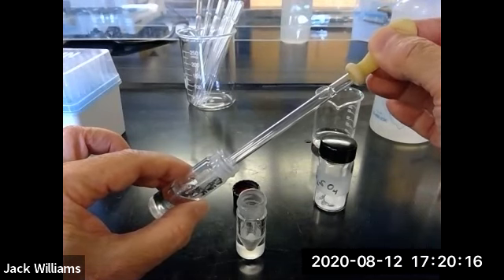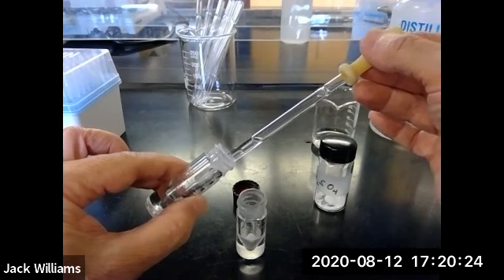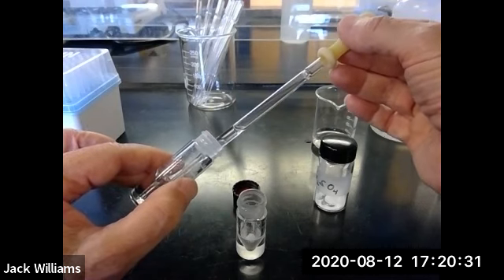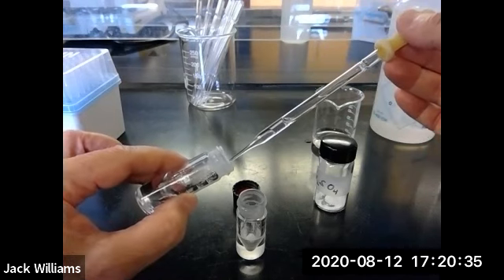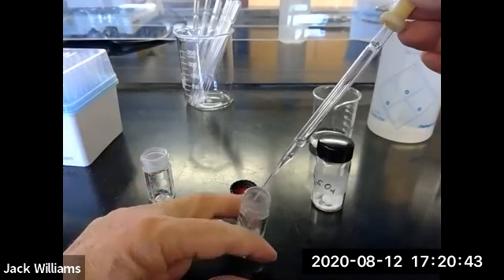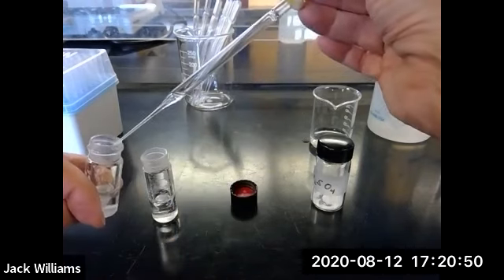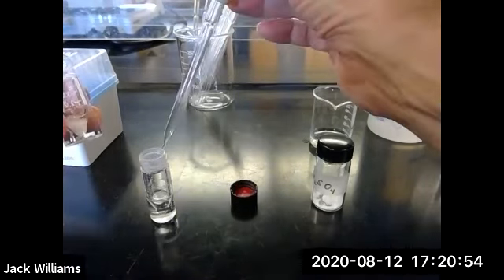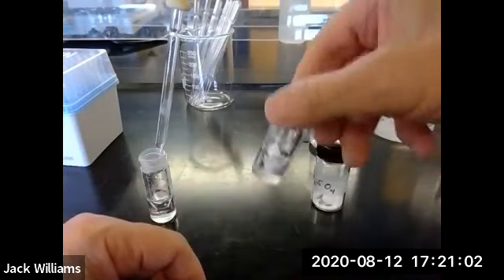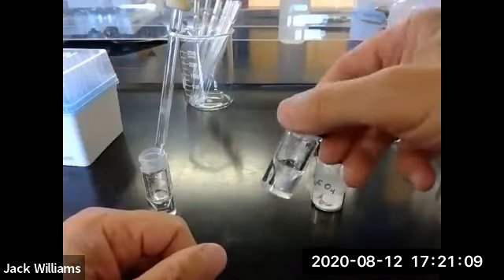Take a look at those films that I gave you. See how it's drawing up there? And you're going to keep some pressure on it. If you make a mistake, you will see, not really a mistake, but see the top layer? So that's what? That's water, right? So I'm still okay because the top layer is water, the bottom layer is methylene dichloride. I can still transfer. I just don't want to get any of that top layer. See the difference in the two layers? All right, so hopefully this is all water. And that's the methylene dichloride, and you want to cap this right away. Super. And then give it time to absorb any water that we accidentally transferred. It'll take a few minutes.